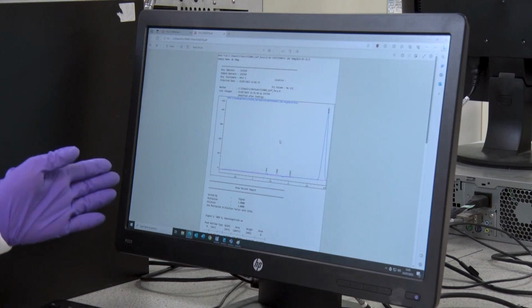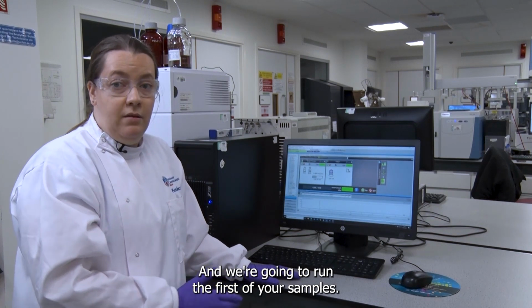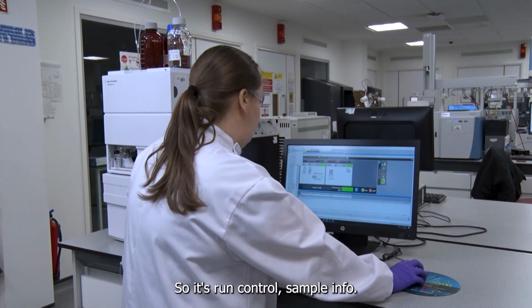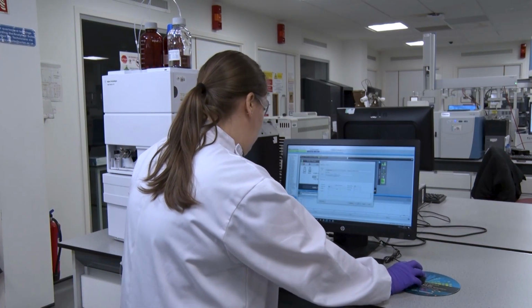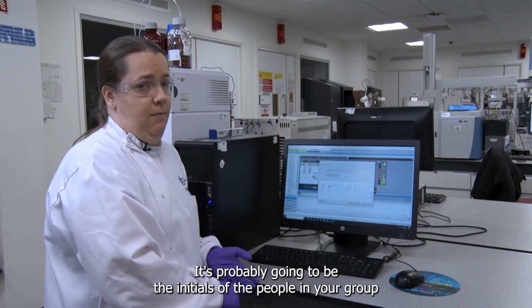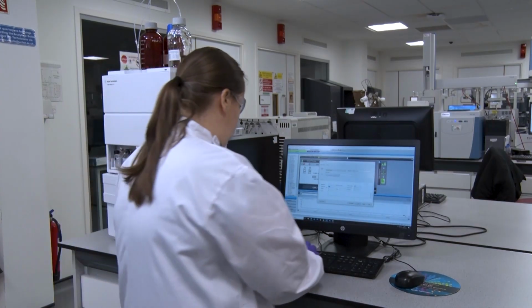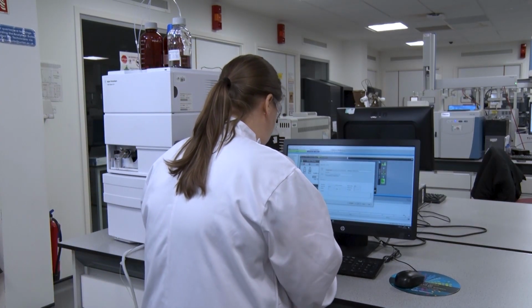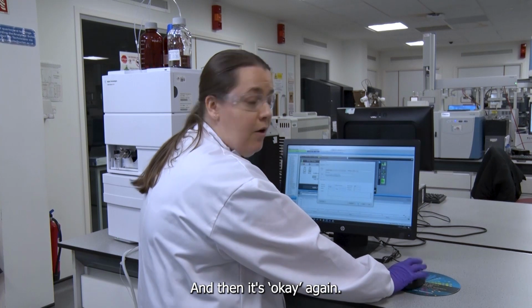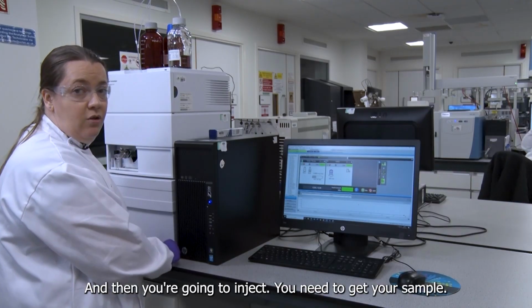So don't close the file, just minimize it, and we're going to run the first of your samples. You're going to put in your details for your first sample. So it's Run Control, Sample Info, and then put a sensible sample name in. It's probably going to be the initials of the people in your group and what the concentration is. And then it's OK again. And then you're going to inject.